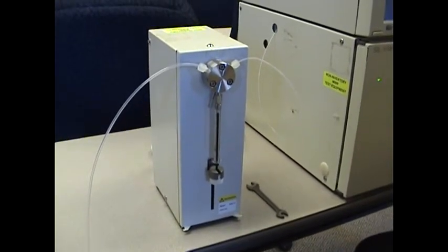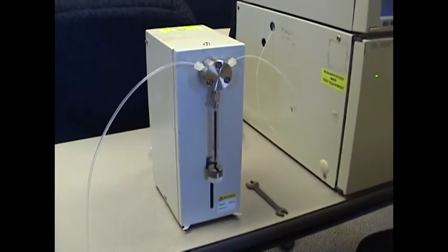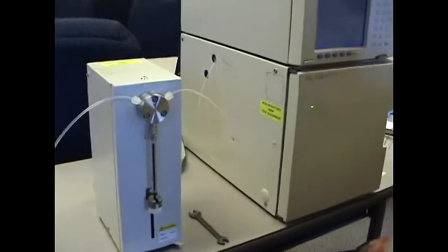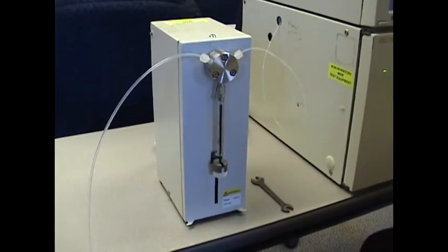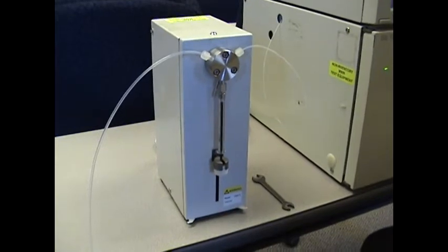Welcome to the Shimadzu training video. This is for the syringe unit for a SIL-10AF auto sampler. We're going to be covering changing out the syringe on the syringe unit.